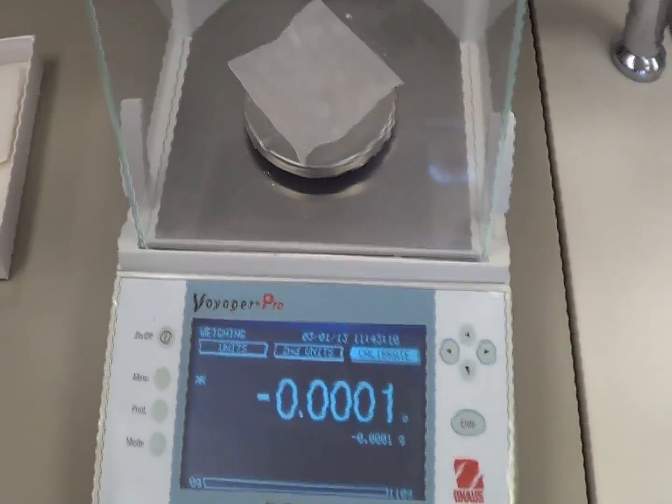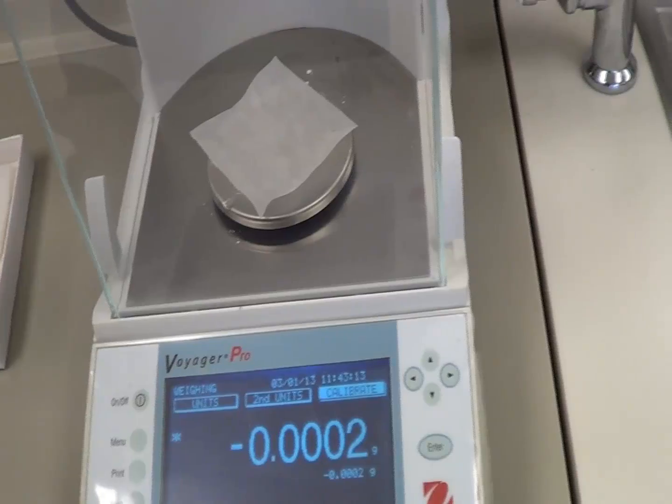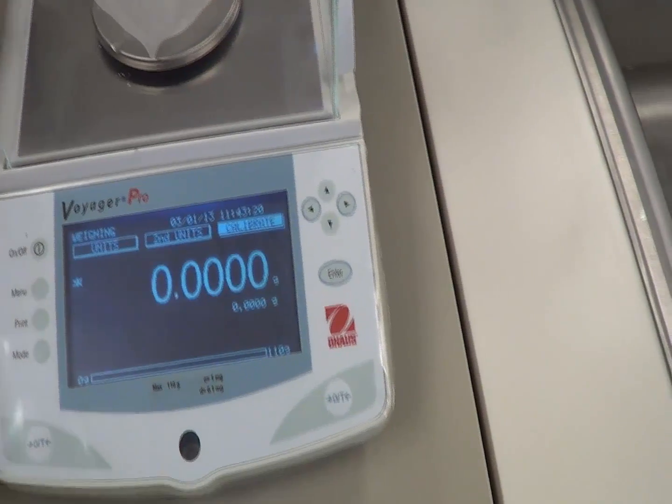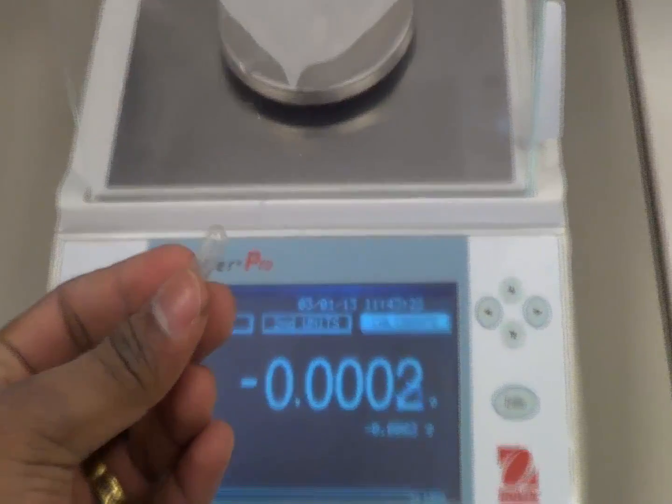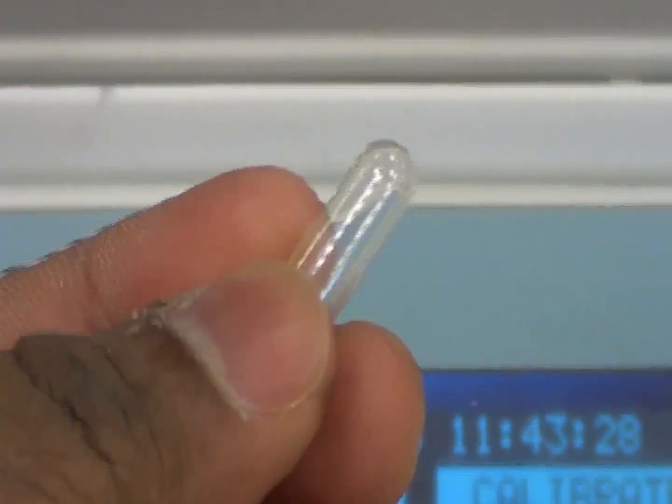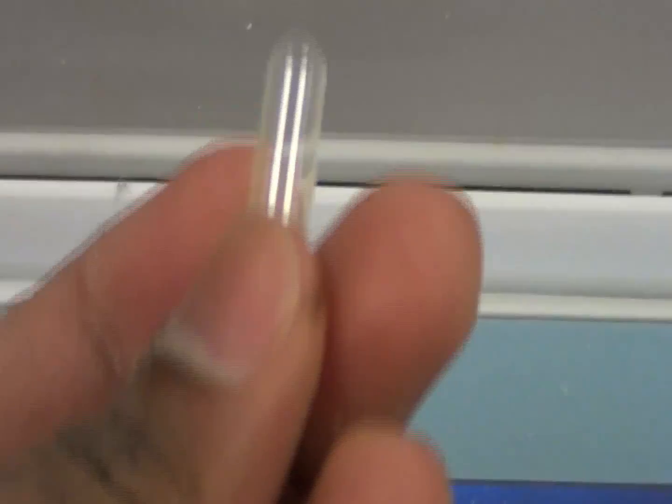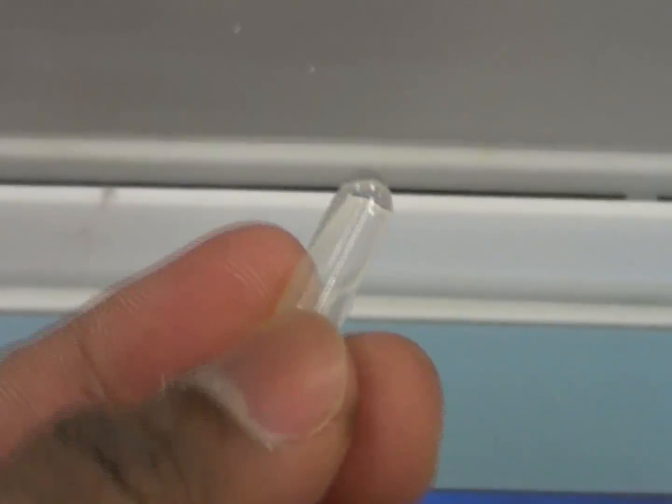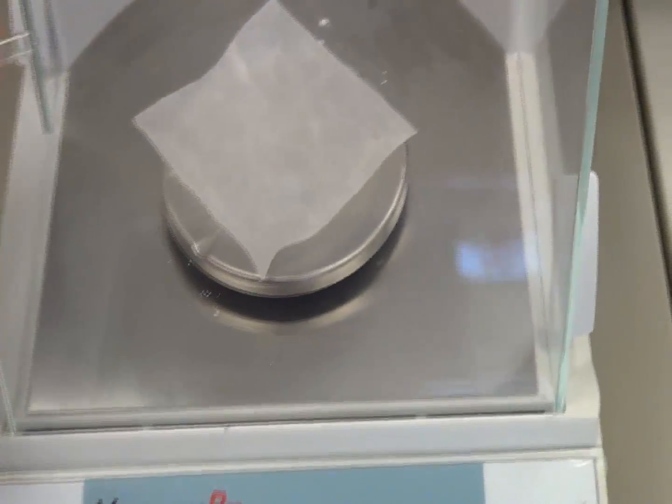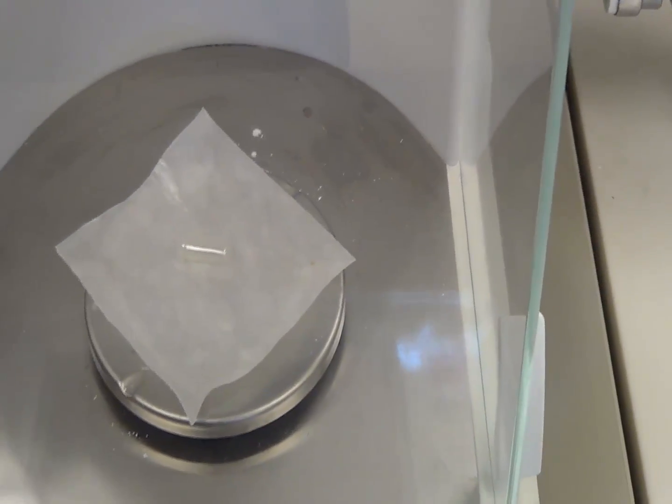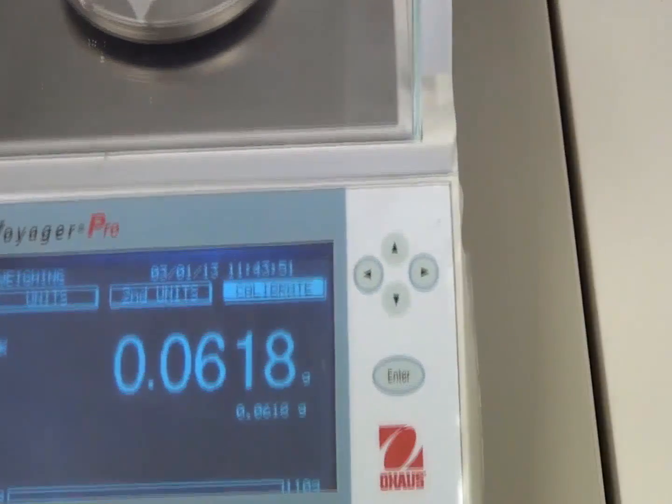Okay, let me show you how to weigh. For example, right now I'm going to weigh a capsule. I would like to see what is the weight of my capsule. So here is the capsule that I'm going to weigh. Of course, I'm not going to use it for any human consumption, just for the purpose of weighing I'm showing this. But if you're going to prepare it for human or for any animal models, make sure you wear the gloves. So I'm going to weigh this capsule. I want to know how much weight is this capsule. Put the capsule in it and close the door, and now see what is the weight.